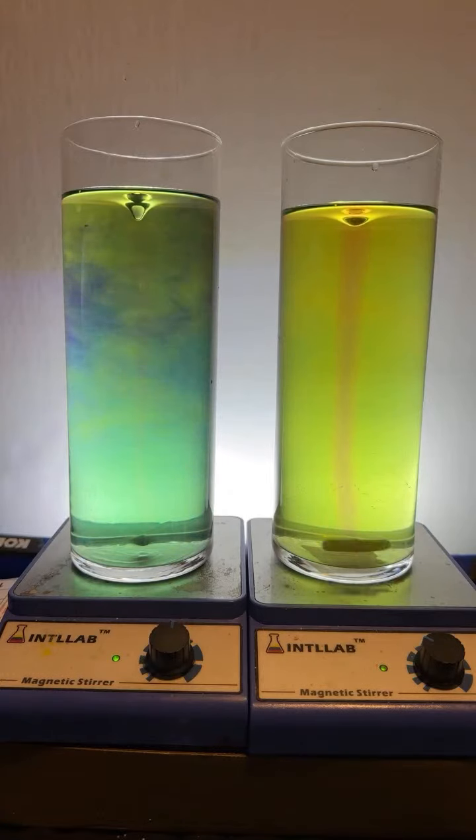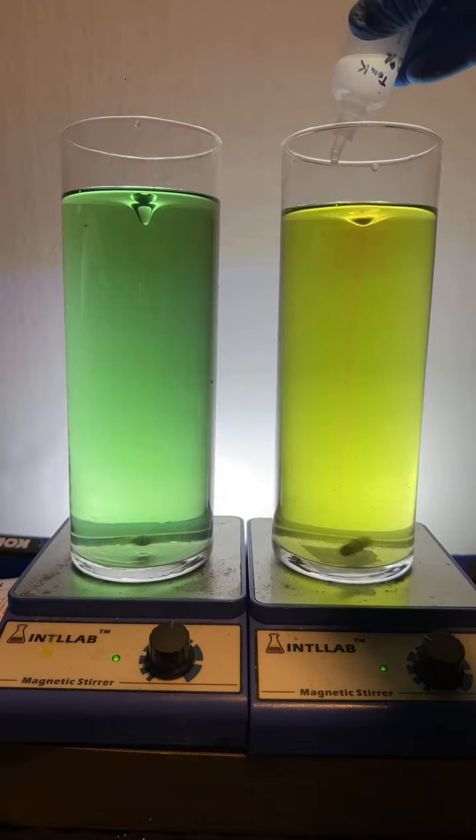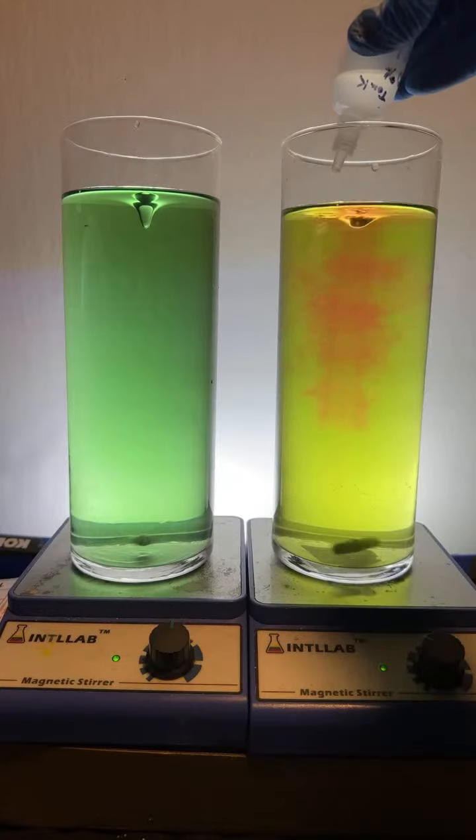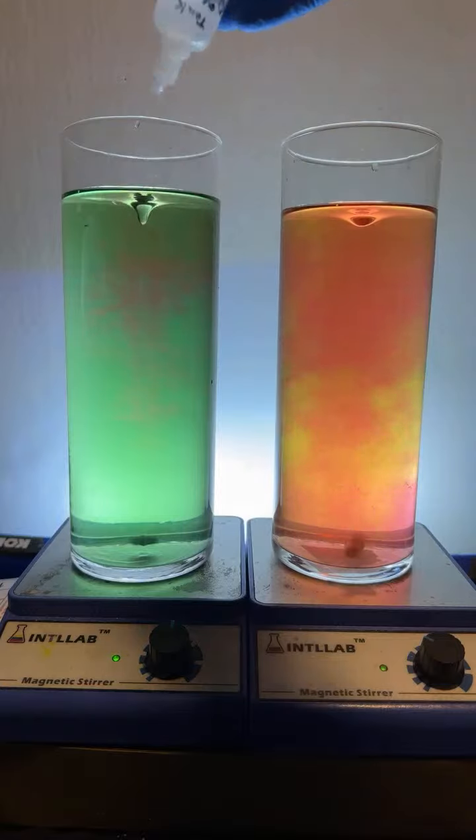I don't think we did. Okay, here we go. We're going to try again. We're going to try to make double rainbow. I'm going to put a bunch of acid over here, a bunch of acid over here. We're going to try that double rainbow one more time.